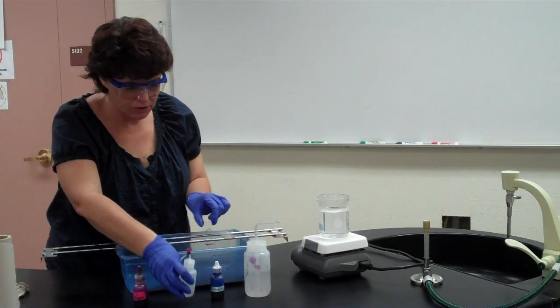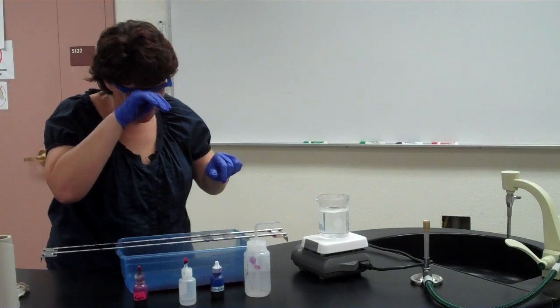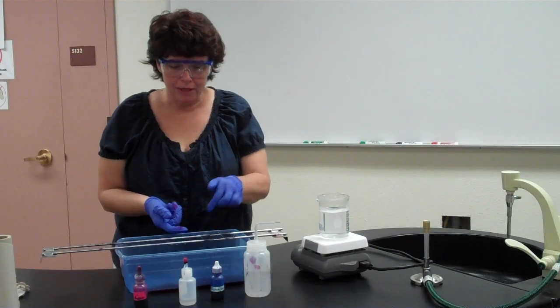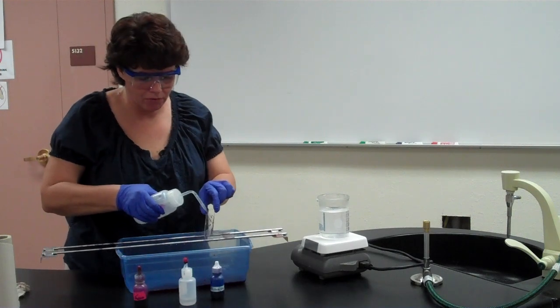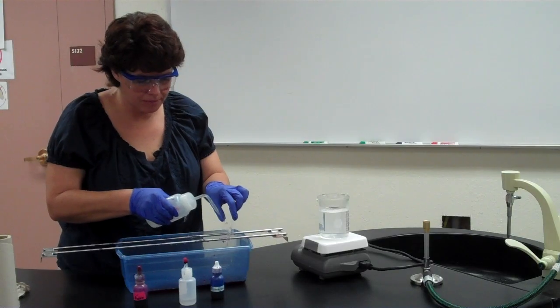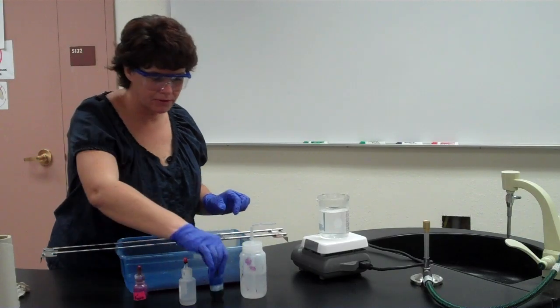I want to point out when you're using the acid that it has a tendency to wash a lot of things off. So when you label, maybe label at the top so that you're not getting acid on it, even though it's on the back. Then we want to immediately wash with water, okay, to stop the decolorizing. Ooh, that smells lovely. All right, the last thing that we're going to do is the counterstain.